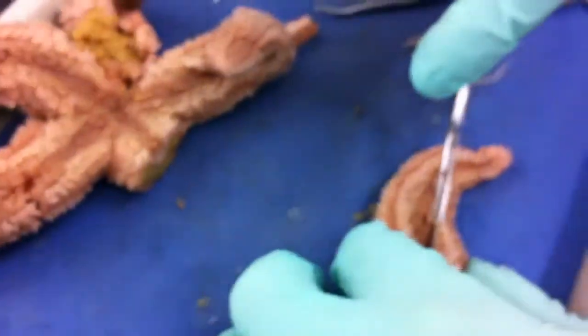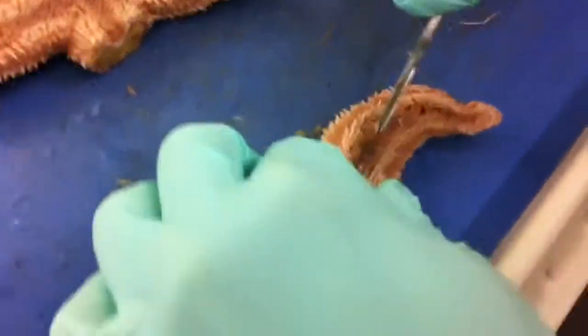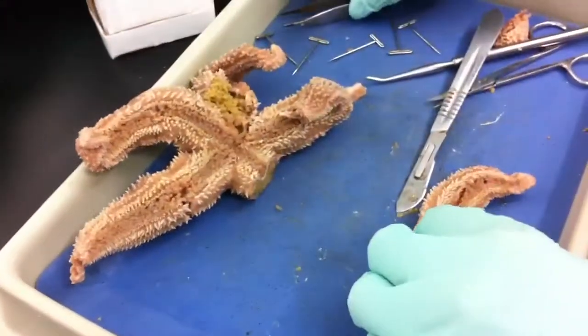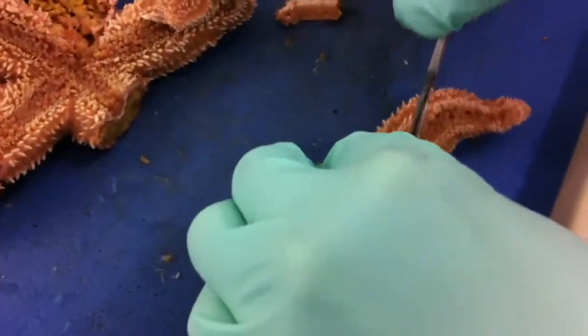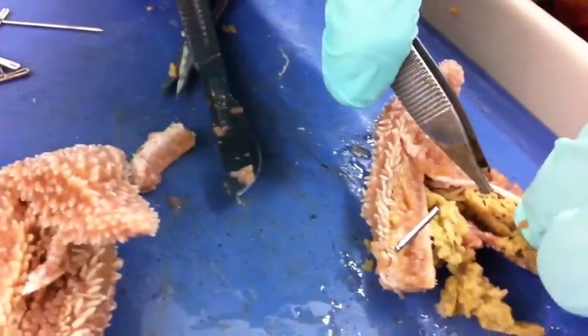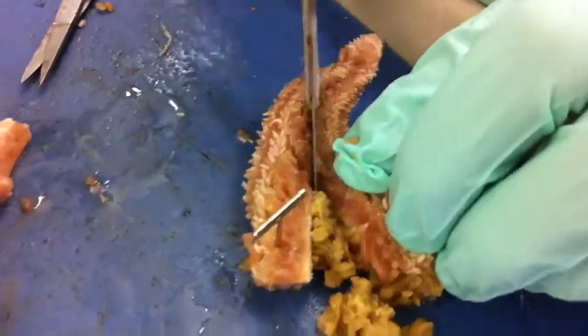Alright, we're trying to pin this open this time. It's tough, it's difficult to cut through, especially with our very blunt scalpel. There we go. I don't even know — we're going to cut it down the middle. We're just going to look at one side.